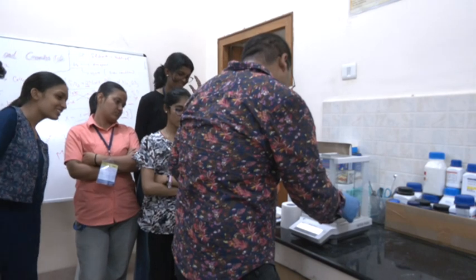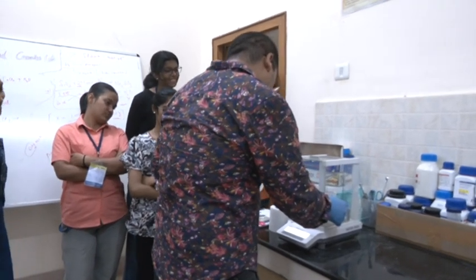It should be exactly 1 gram, because accuracy is important.